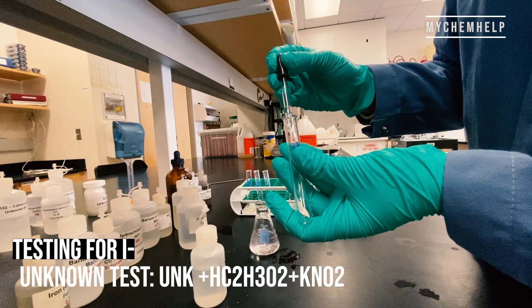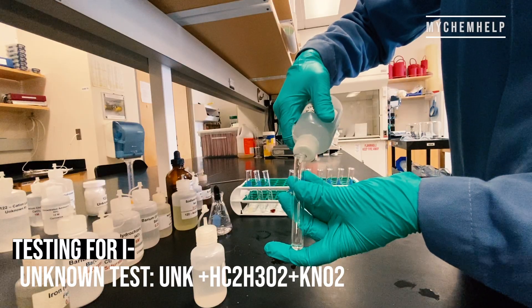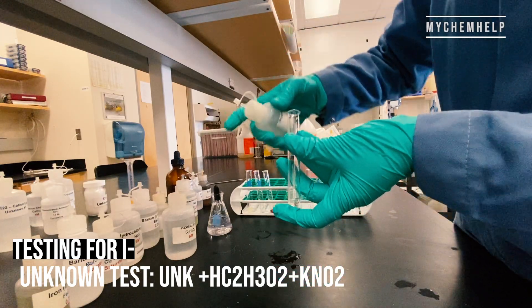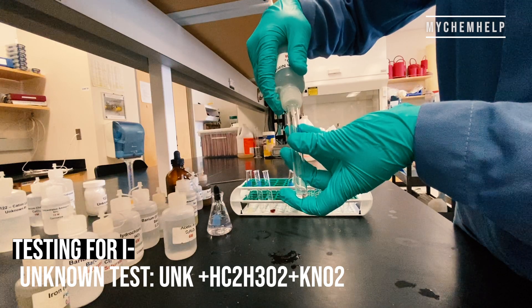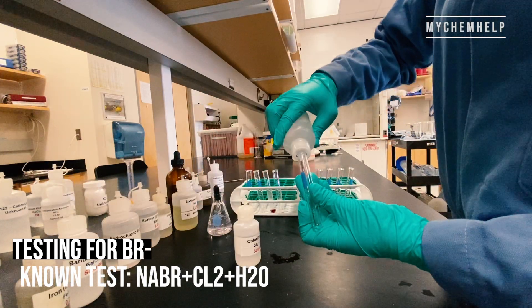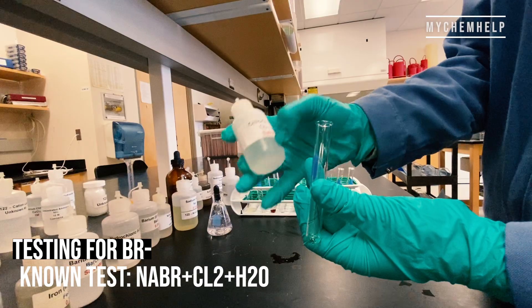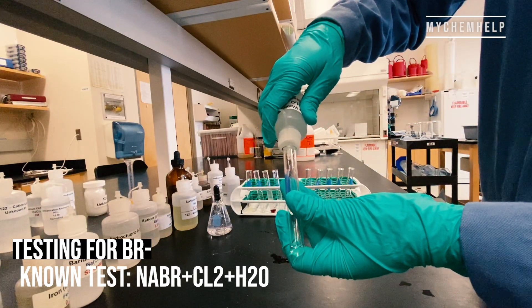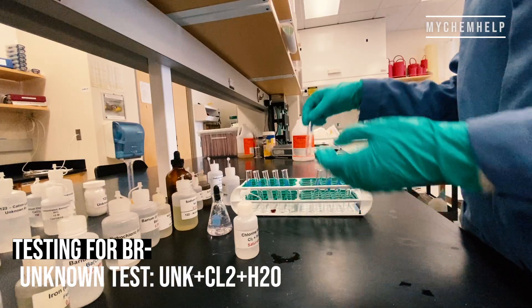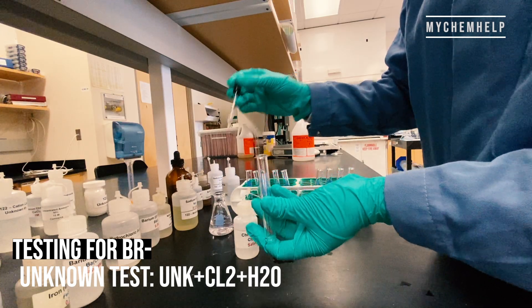Now let's test our unknown for iodine. Next we're on to bromine — that's the Br⁻ anion we're looking for. To the test tube I added sodium bromide plus chlorine water, and that was supposed to turn brown. I'm not really sure what happened there, but even though I didn't see the reaction I was hoping for with the known, I'm still going to test my unknown just to see what happens.